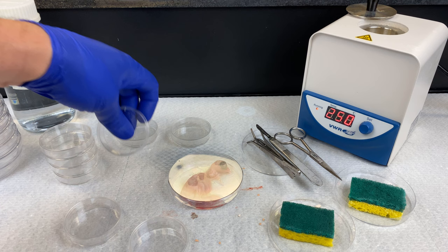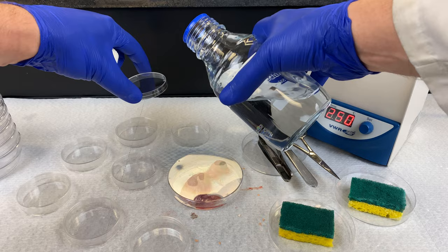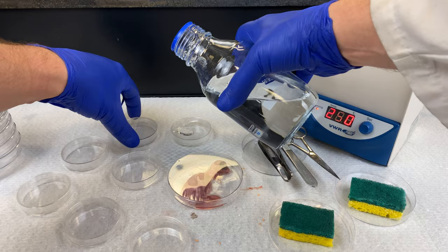This would be the third video in the series. If you haven't watched the first ones, go back and watch those before you watch this one. In the previous videos, we removed the chicken from an egg sterile, cleaned it, and took off its head. Now we're going to dissect out its organs.